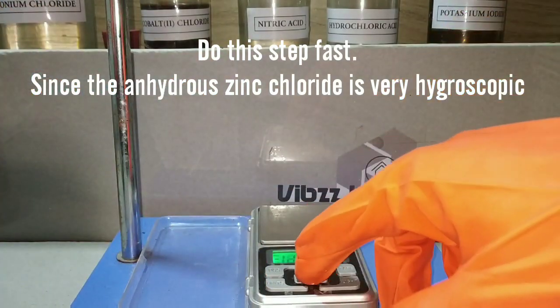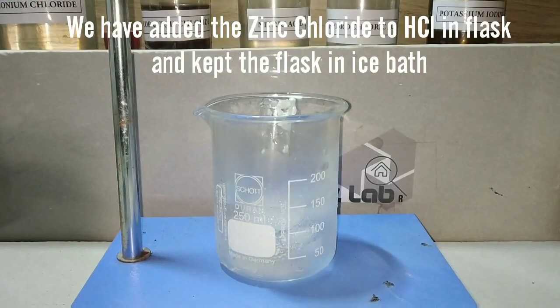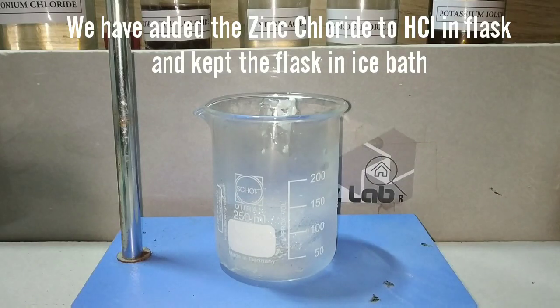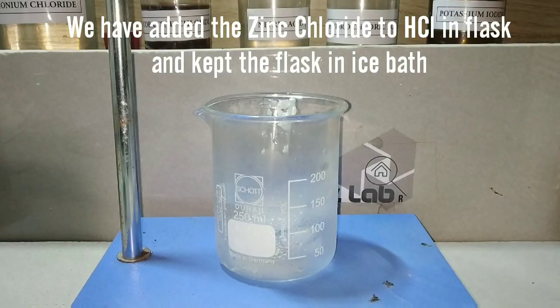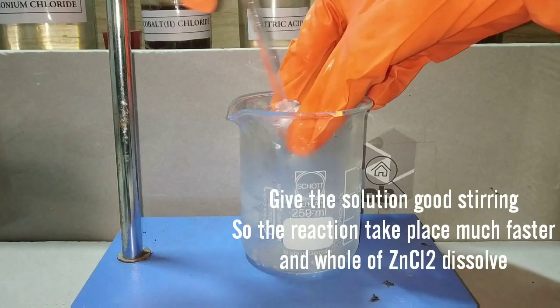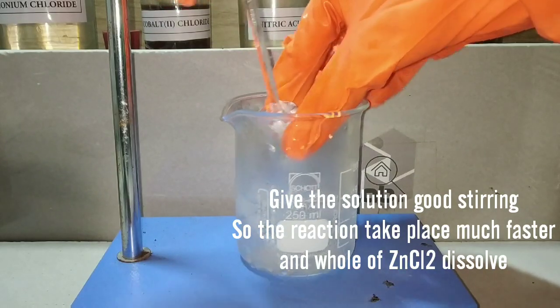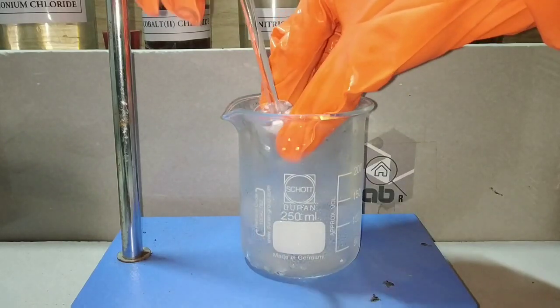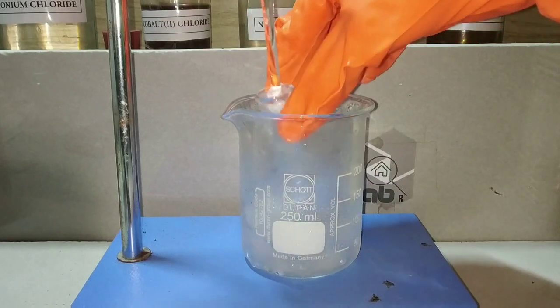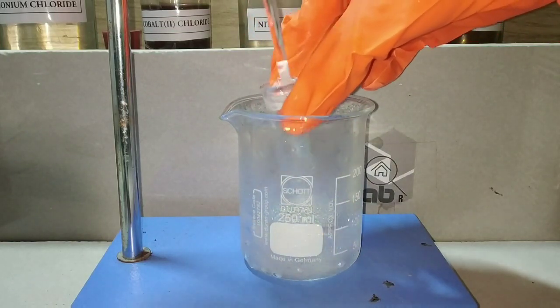We measure out anhydrous zinc chloride as quickly as possible. I have already added the zinc chloride into the acid and kept it in the ice bath. After adding the zinc chloride, we need to give it a good stirring so that the zinc chloride dissolves in the acid. If you have a magnetic stirrer, that would be the perfect option here.